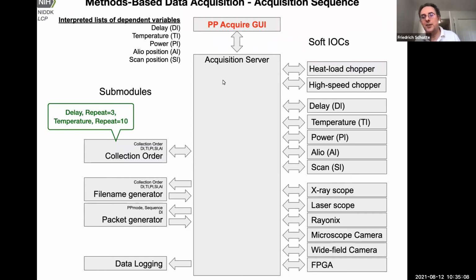You see, this acquisition server is not doing much actually. It just talks to other IOCs that are responsible for the various aspects of data collection. For example, scanning the time points, the timing system. There's a subsystem called delay, which talks to the timing system, which generates all these packets with different time delays encoded, uploads them to the FPGA and starts playing them. So it's a separate IOC. If you want to do a temperature ramp, that's also outsourced to a temperature scan IOC. Other things, you can modulate the laser power by rotating an attenuator wheel, or you can scan a motor if you want to do alignment scans of your sample.